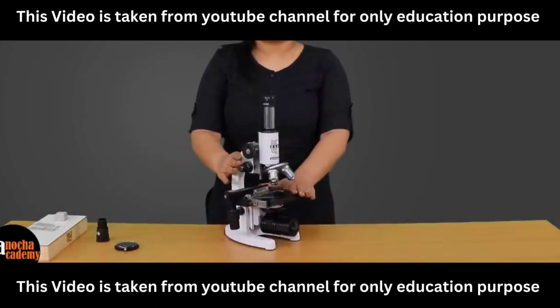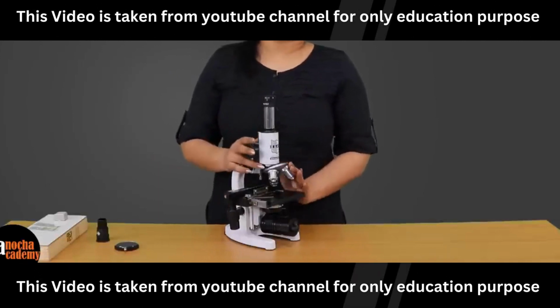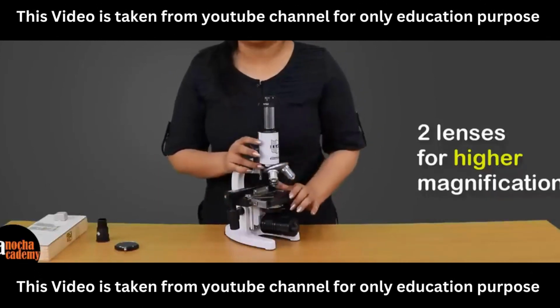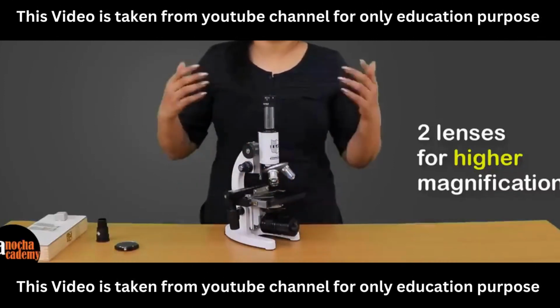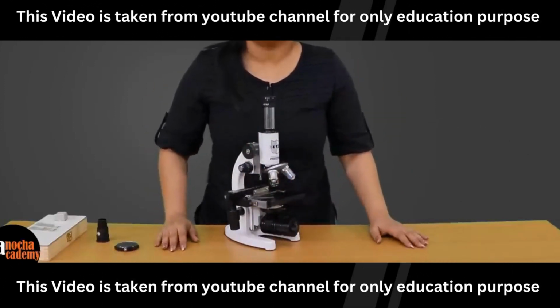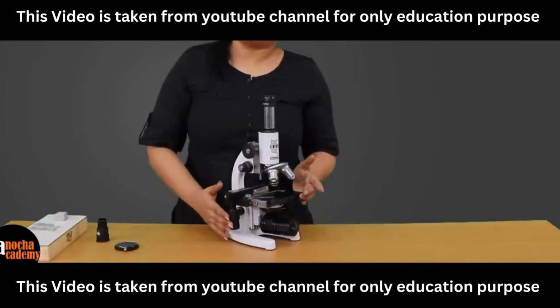Why is it called a compound microscope? It is known as a compound microscope because in this microscope, we use two different lenses with different magnifications so that your final image has a much larger magnification. So let us see what are the different parts and how they help in observing specimens.